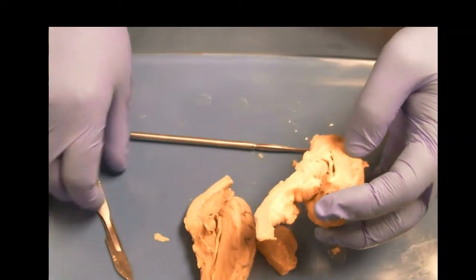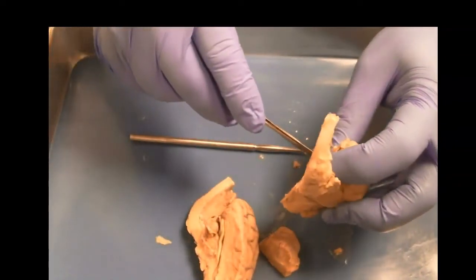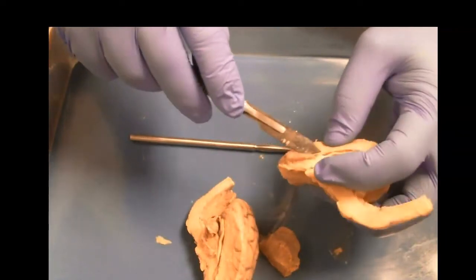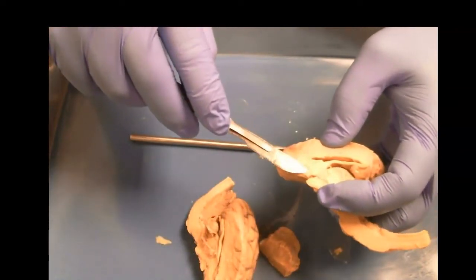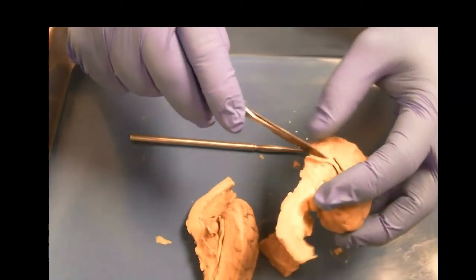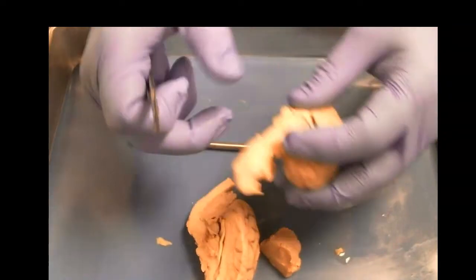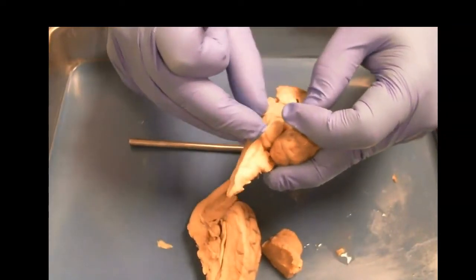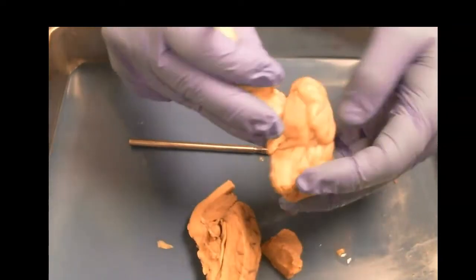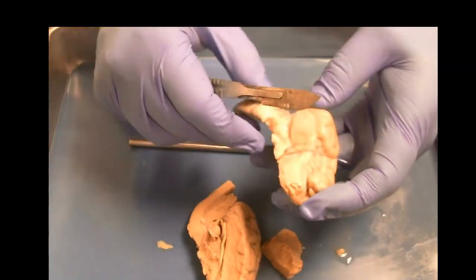So we've got that, and now if we want to see the thalamus a little more, we're going to cut through here and try to remove. So here's the basal forebrain, which is pretty close to your limbic system, and we come in here and we see these really strong tracts running through. What we're going to look for, and maybe we'll find, is the hippocampus.